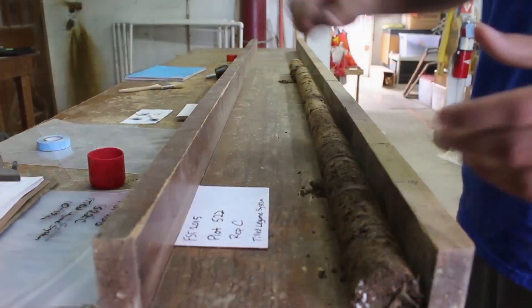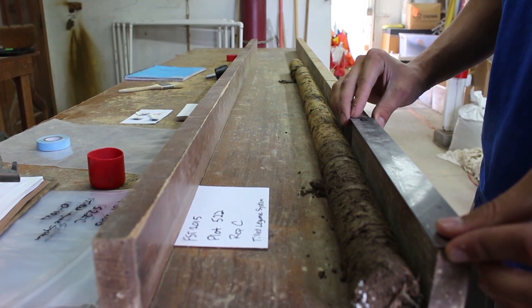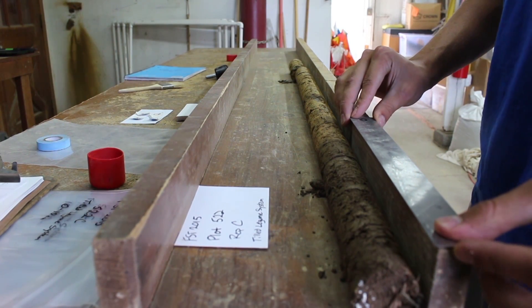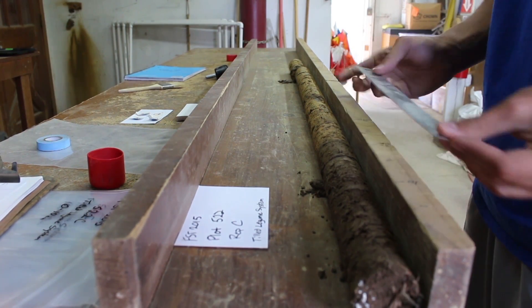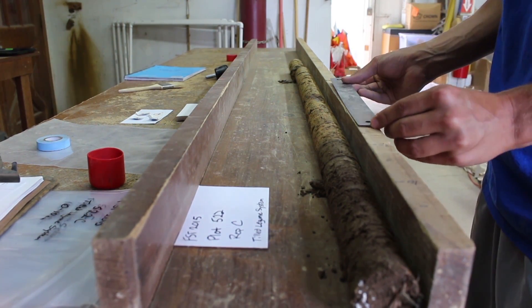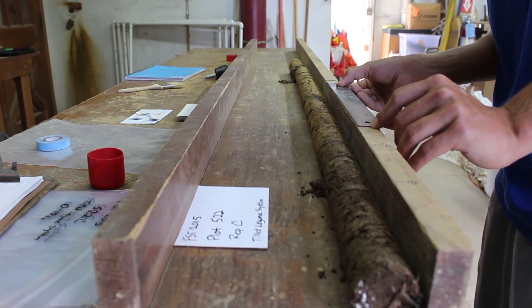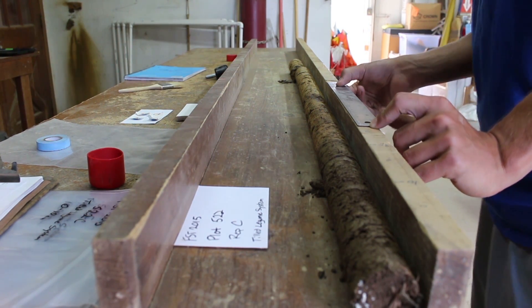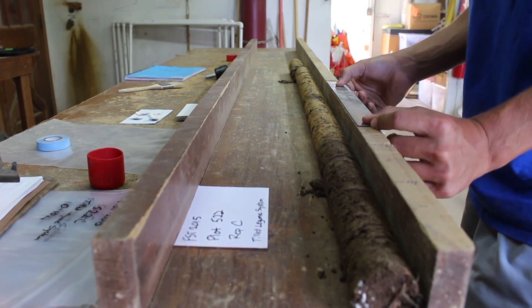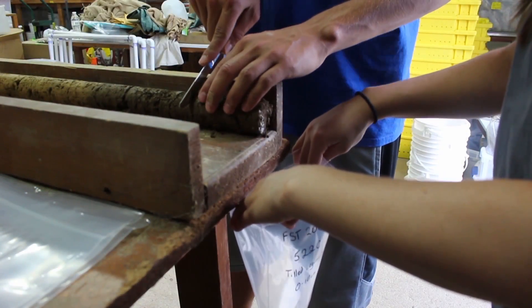As you can see, the soil is cut into 0–10, 10–20, 20–30, 30–60, and 60–100 cm portions. The different lengths that the soil core is cut into are then weighed to determine the wet weight of the soil.